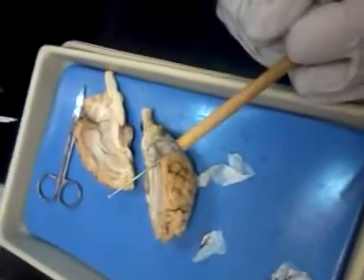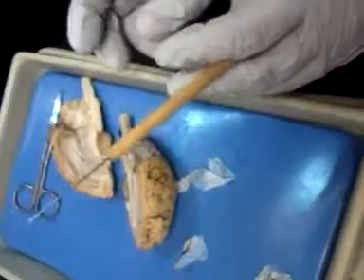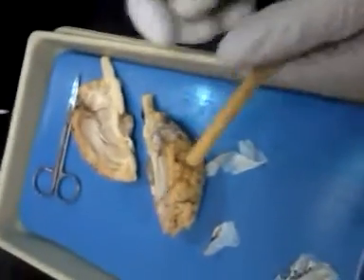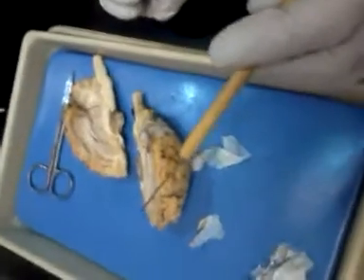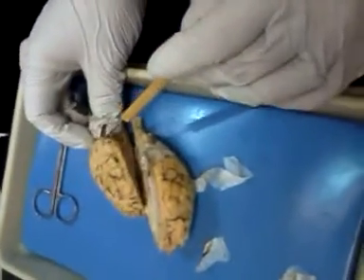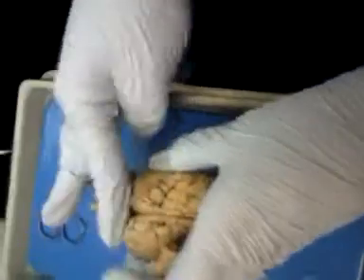The pia mater? The arachnoid mater in the middle, you can't see it. It's very delicate and webby. That's where it gets that arachnoid name. Spider-like, spider-webby. Okay? And then this you cut down with your longitudinal fissure. This right here is your transverse fissure, the one that goes across the back here. All that part of that.